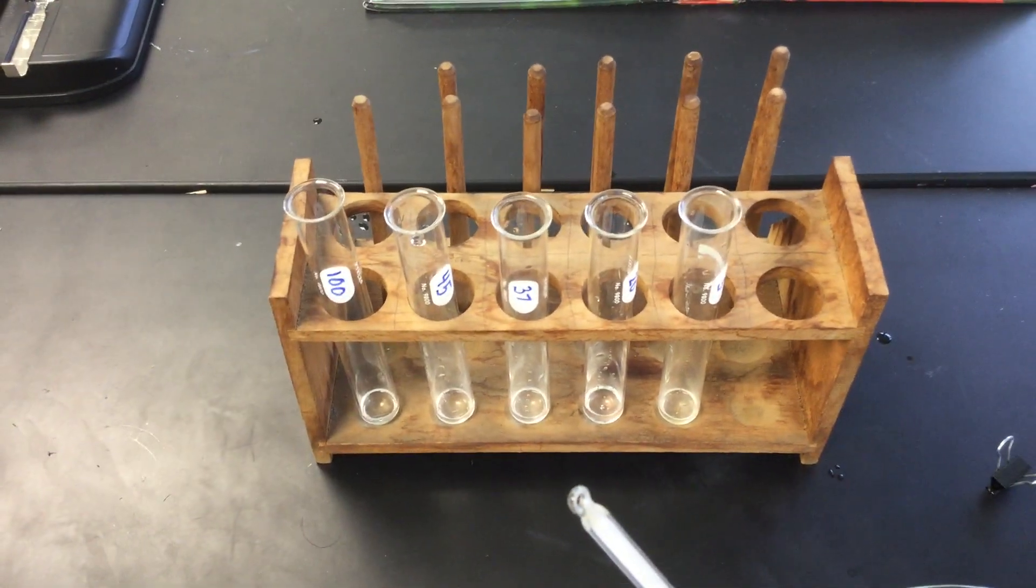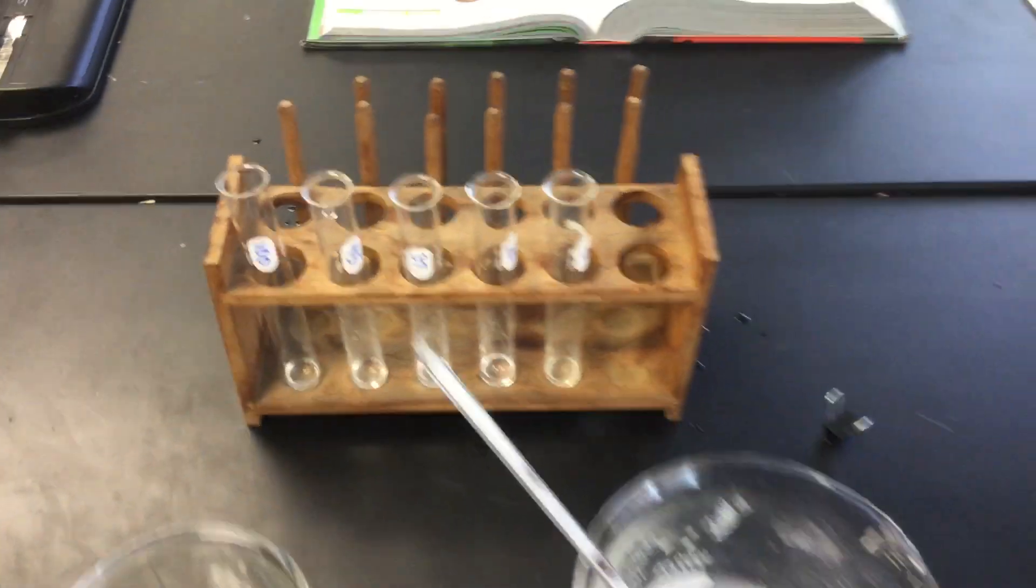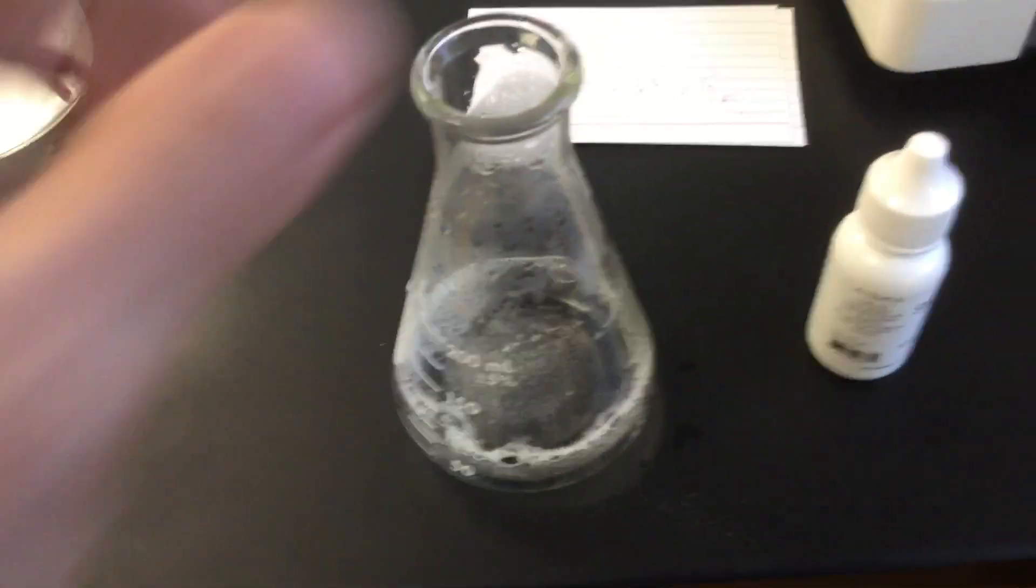And what I'm going to add to each of these is a little bit of saliva, which I have collected right here. And this is my source of amylase.